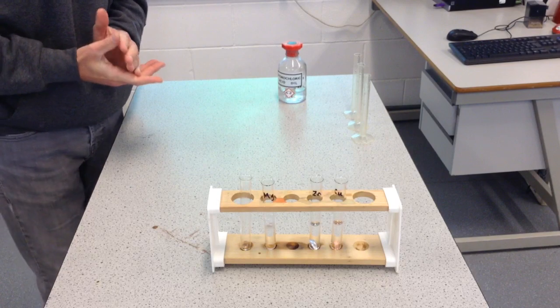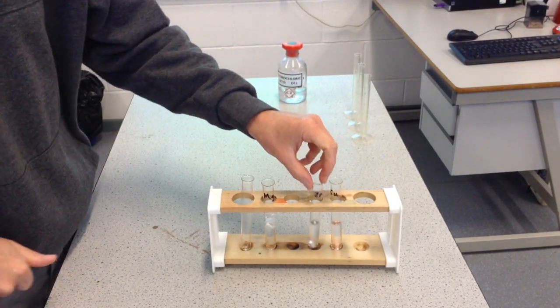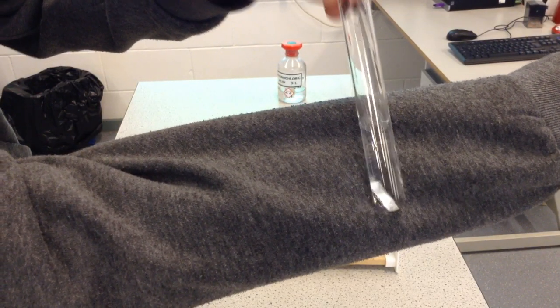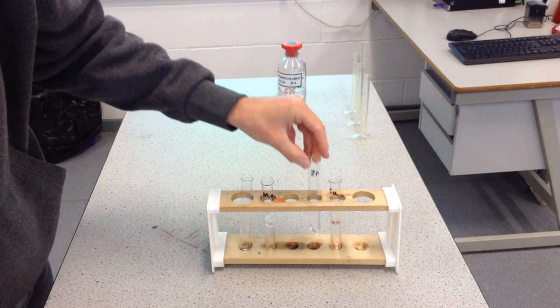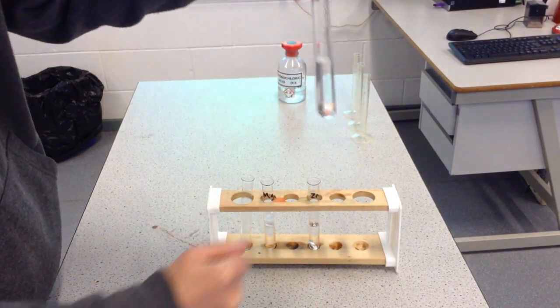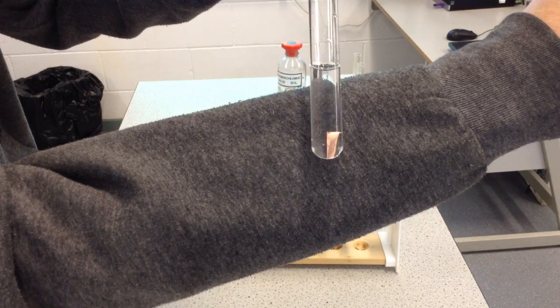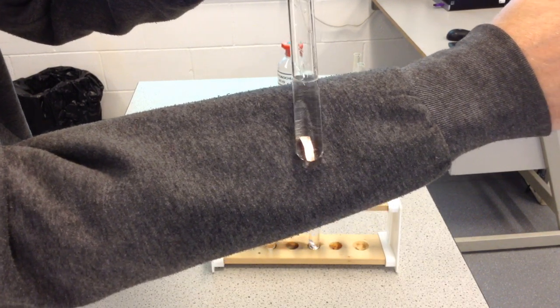But hopefully you've seen... In fact, I'm going to show you the zinc again, actually, because that has now reacted. You can hopefully see the gas bubbles there a little bit clearer. Again, I'll give them a little knock. Okay, so you can hopefully compare the reactions back to the copper. No, still doesn't look as though it's done anything there.